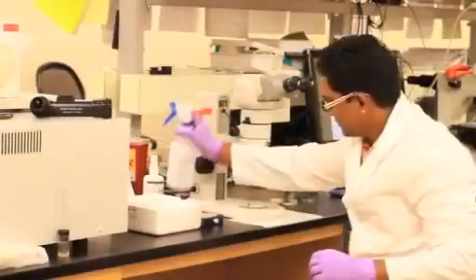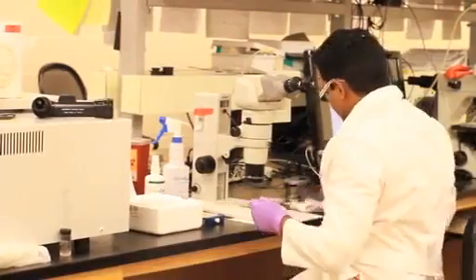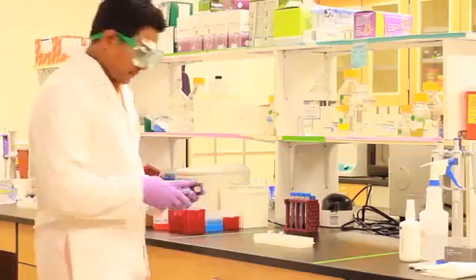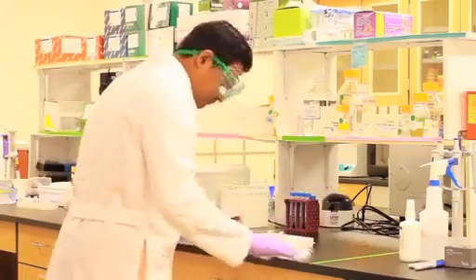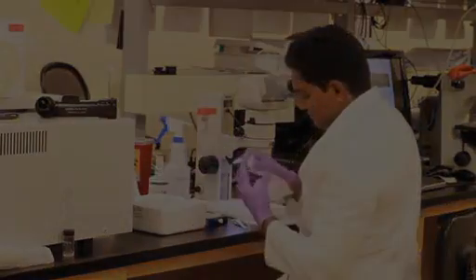Before we begin the RNA work, it is important to take standard precautions to avoid RNA degradation by maintaining a ribonuclease-free environment. While wearing gloves, clean the work area, pipettes, and all required apparatuses with RNase decontamination solution.